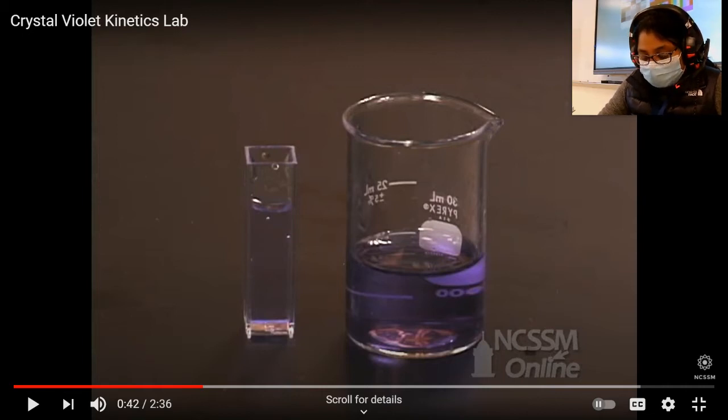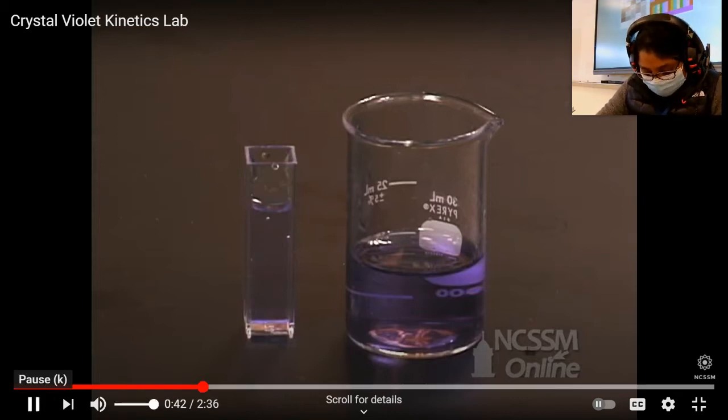because the reaction has already started. The reaction starts the moment you mix the sodium hydroxide with the crystal violet, okay? It's already starting to slowly fade. Now, you put this cuvette in the colorimeter, you close it, and you start to collect absorbance values on your screen, and you collect a point of data every 20 seconds until you reach 900 seconds, okay? The first few seconds of data you can't actually count because it's going to take you some time to get this cuvette into the colorimeter and to start collecting data. So the data that we have collected is sound from 40 seconds onwards, okay?